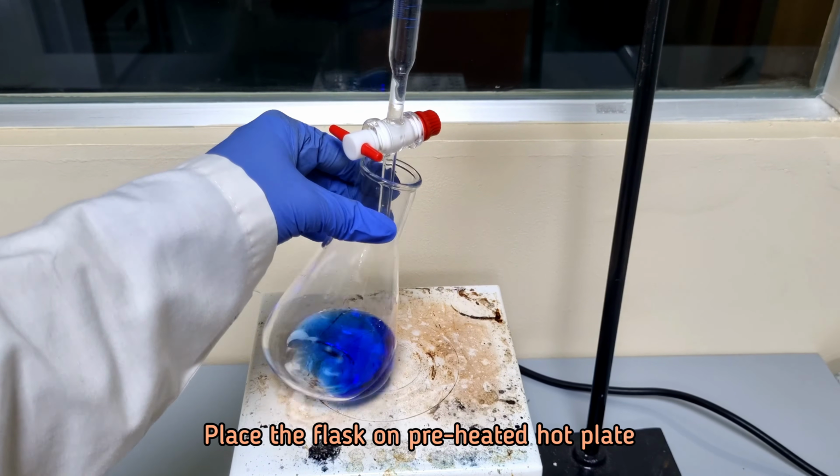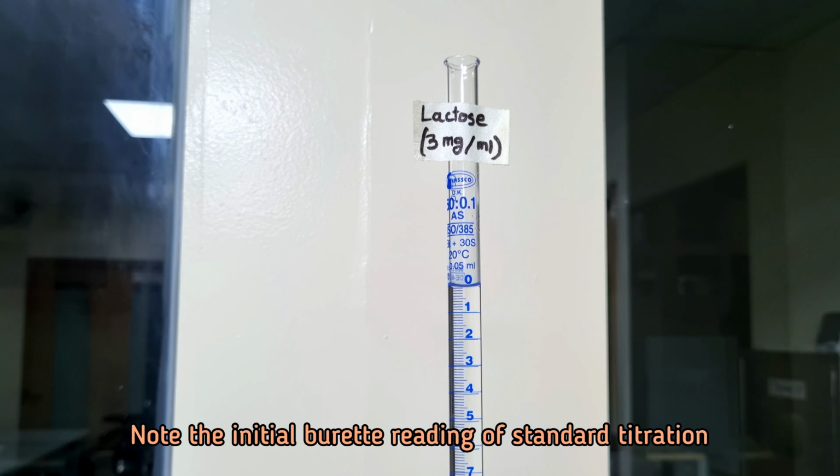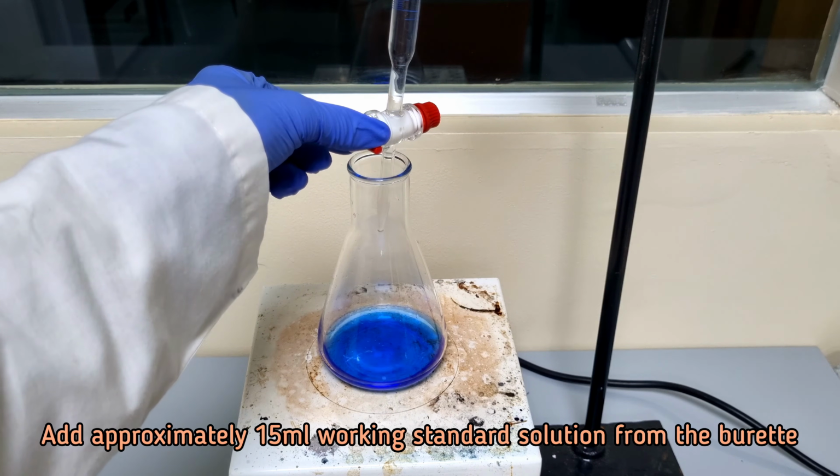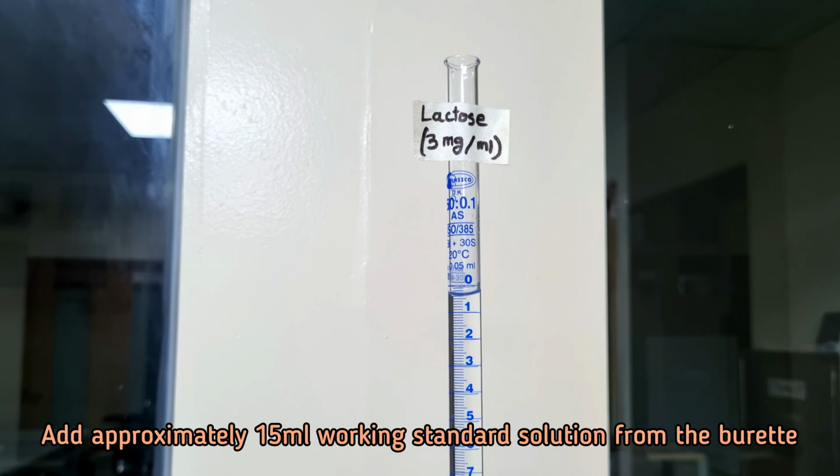Place the flask on preheated hot plate. Note the initial burette reading of this standard titration. Initially, add approximately 15 ml lactose standard solution from the burette at a time.